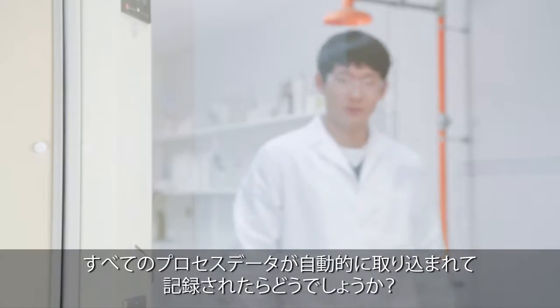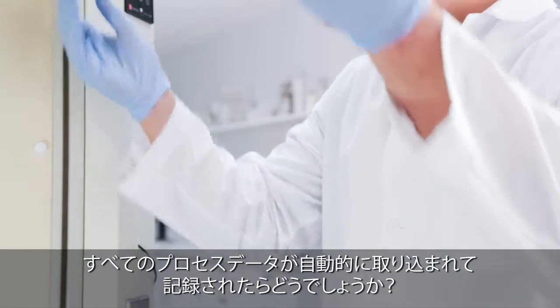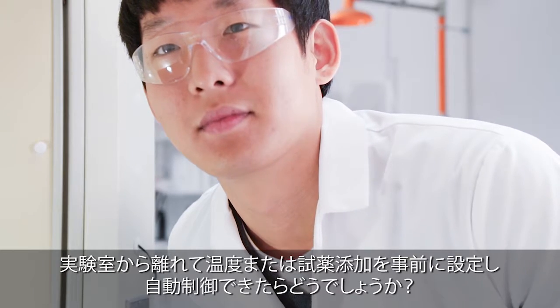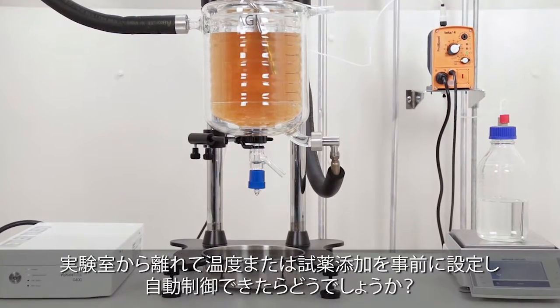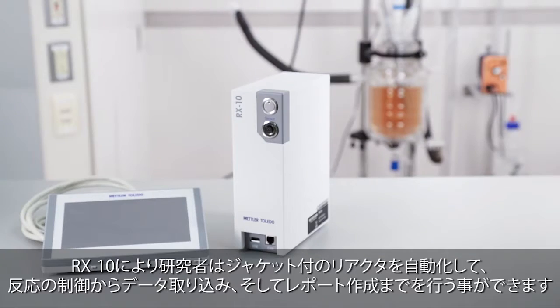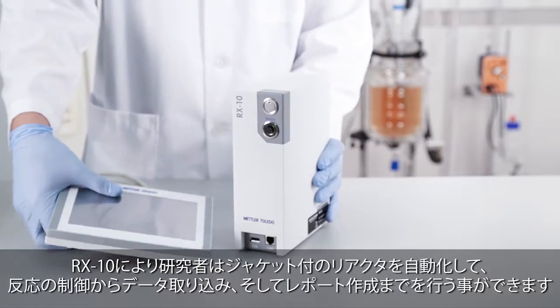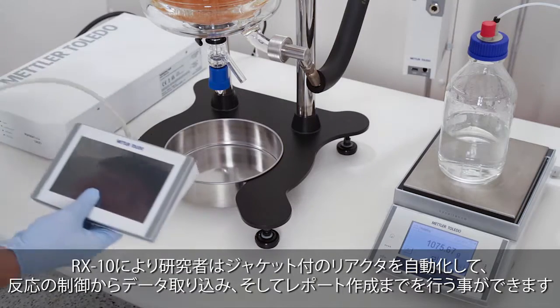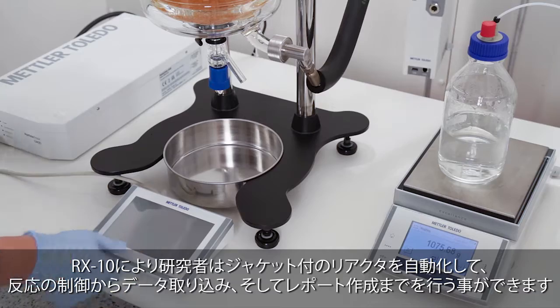What if all your process chemistry data was automatically captured and recorded? What if you could reprogram and control temperature or reagent dosing without being present in the lab? RX10 enables scientists to automate their jacketed lab reactor systems for enhanced reaction control, data capture and reporting.